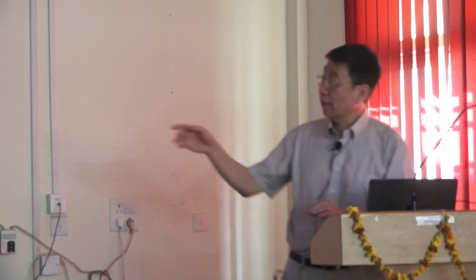So you saw the primer I wrote as Professor Shukla shared with you, right? Did you have a chance to practice a little bit with that yesterday? Was that useful? All right, let's get started. My folder has more files than yours, but that's okay. We're using the same files, okay? So just start Coot.